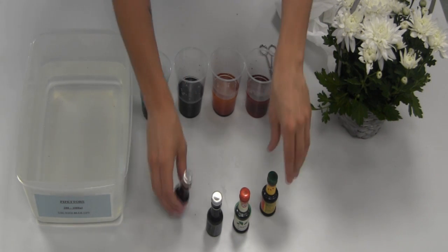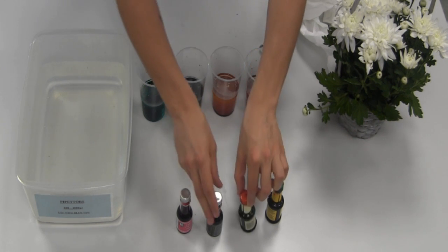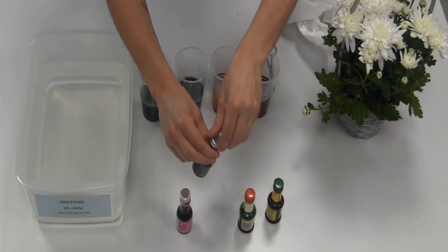Make sure you put the lids back on firmly, as it will make a mess if you move it.